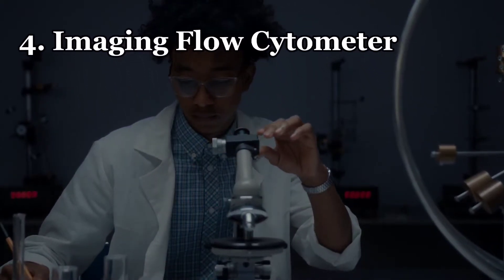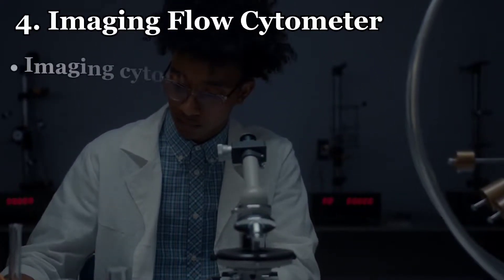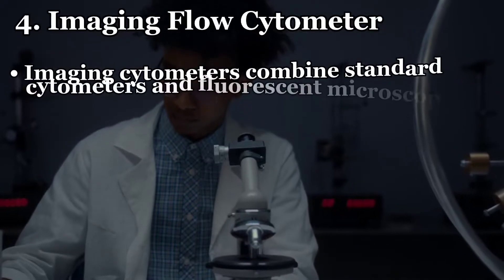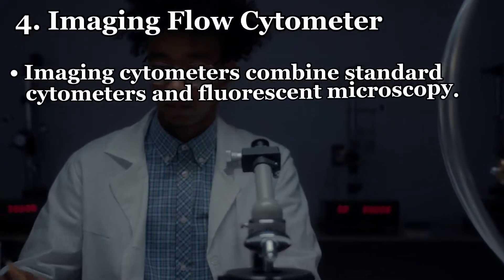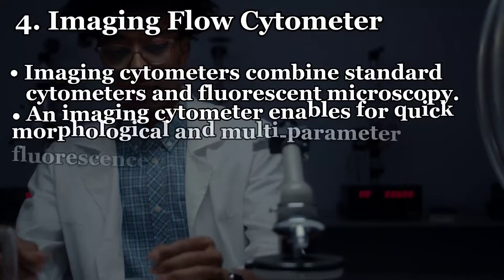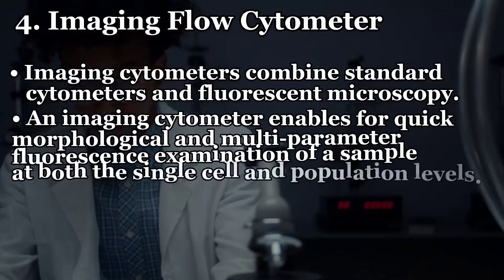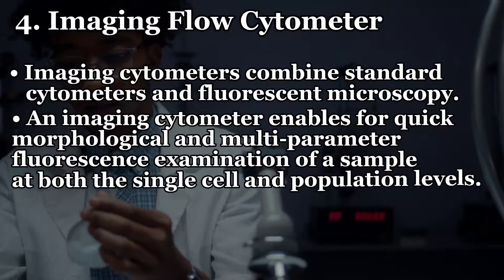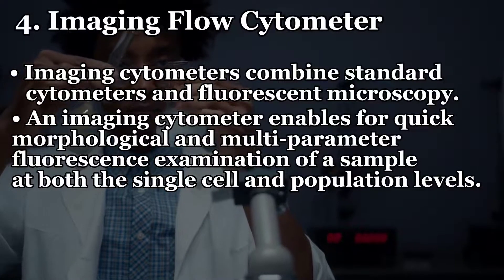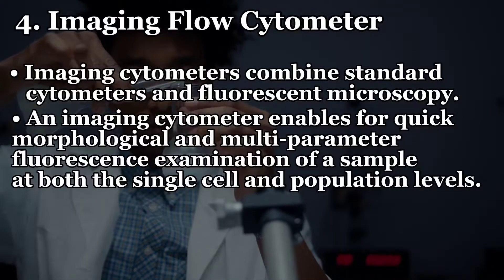Imaging flow cytometers combine standard cytometry and fluorescence microscopy. This enables quick morphological and multiparameter fluorescence examination of a sample at both the single-cell and population levels.